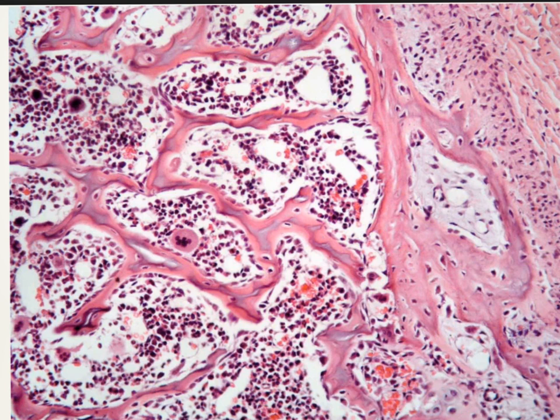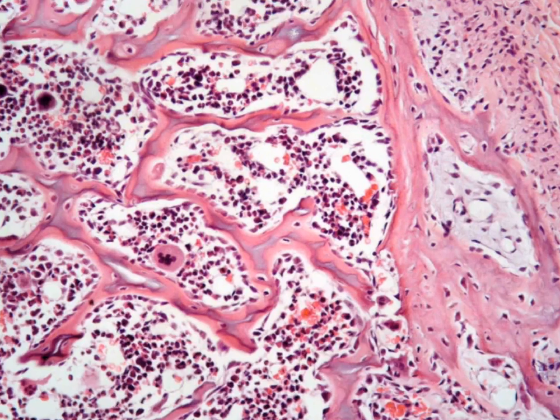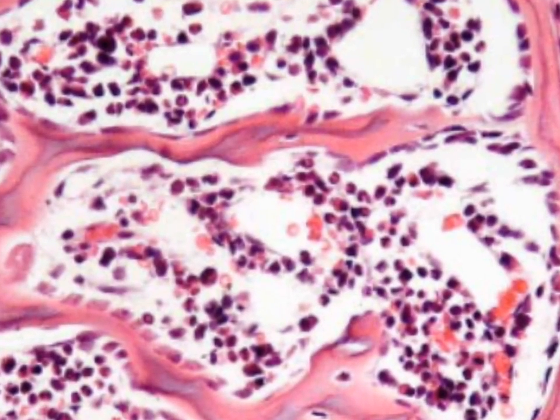In the spongy bone trabeculae, I can enlarge the picture more and you can diagnose what? Here in the bony trabeculae, this is the red bony trabeculae, we have the osteocytes inside. While in the lining here we have lining cells, these cells here are the osteoblast.